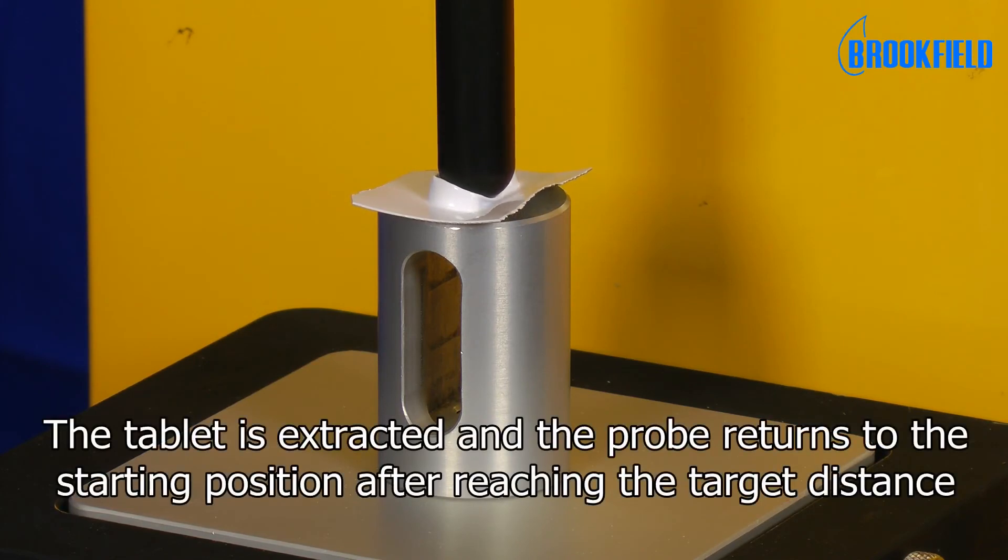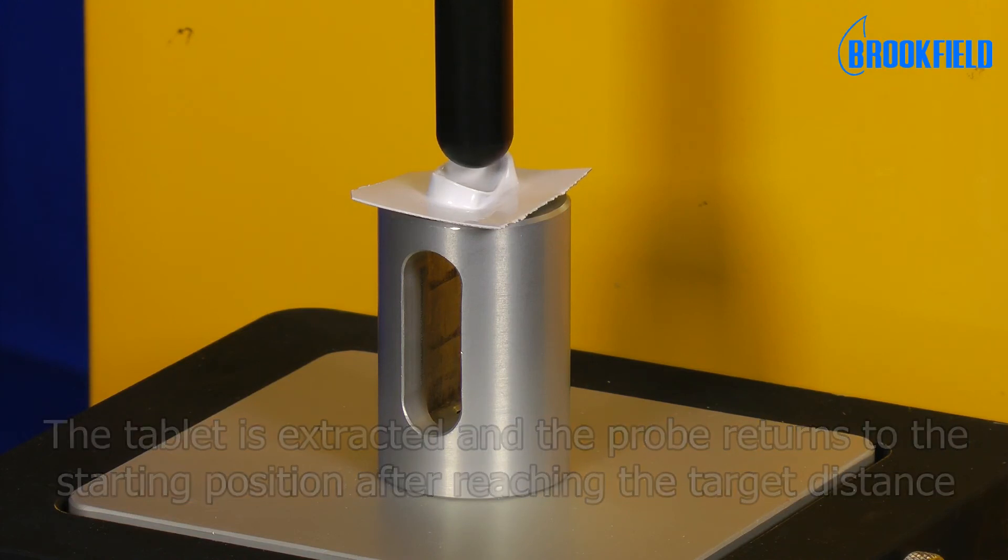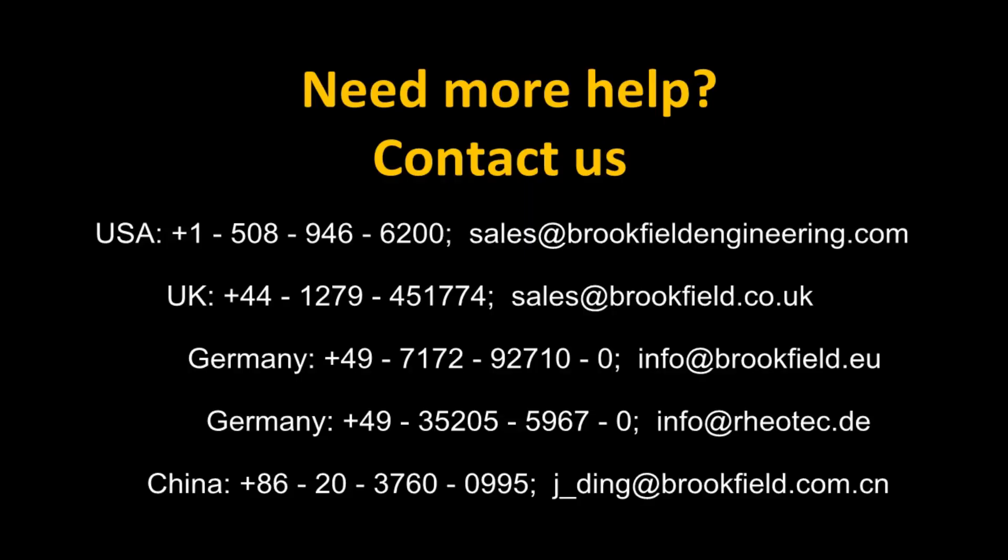Once the target distance has been attained, the probe withdraws and returns to its starting position. If you need more help, we are more than ready to assist.